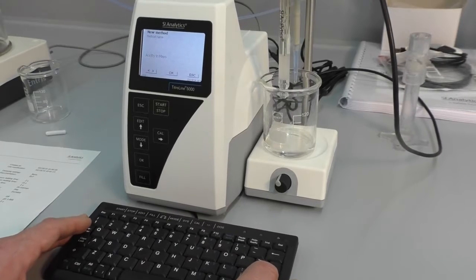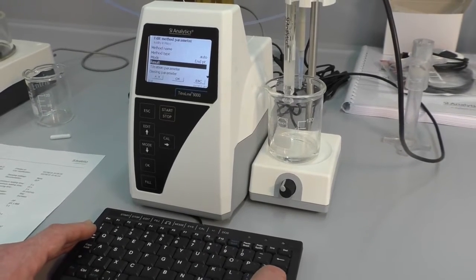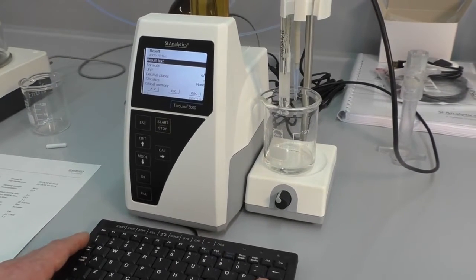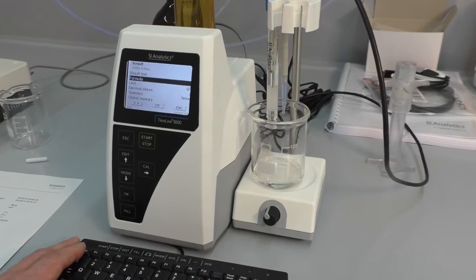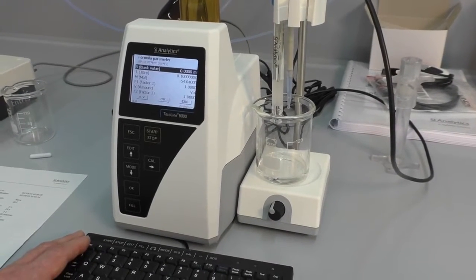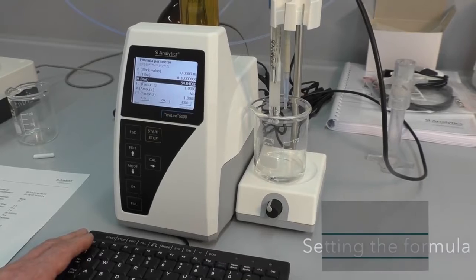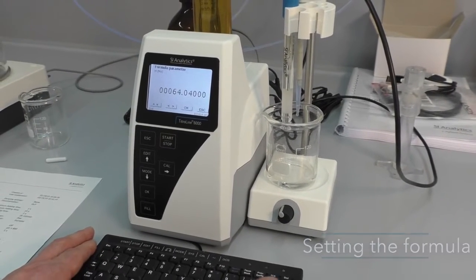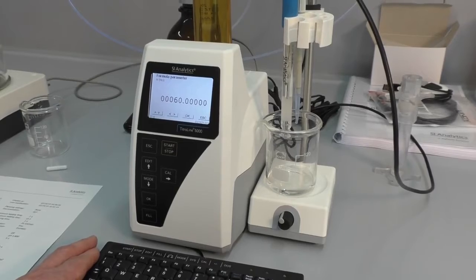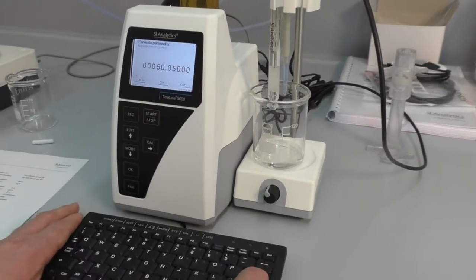Okay, fine. Next step is we have to change the result calculation, because the acidity is fine, but the formula has to be changed a little bit, because now we have the equivalent weight from citric acid here. We will have to change it to the molecular weight of acetic acid.